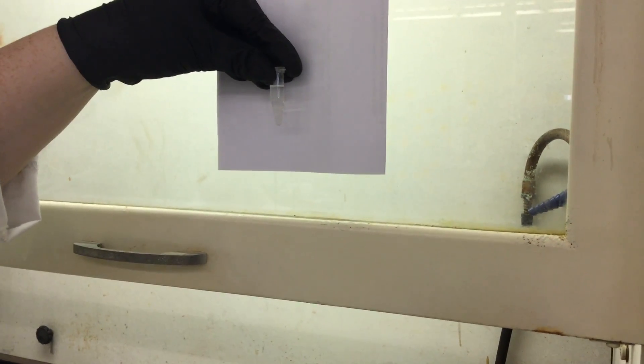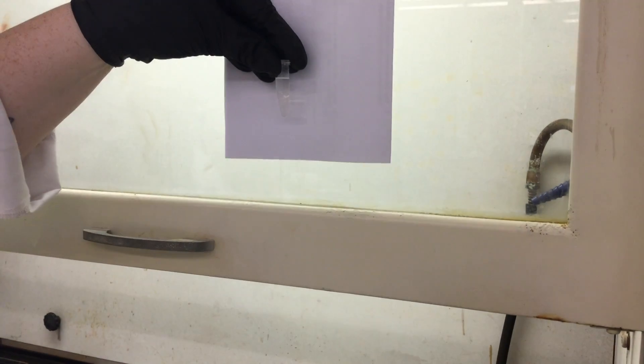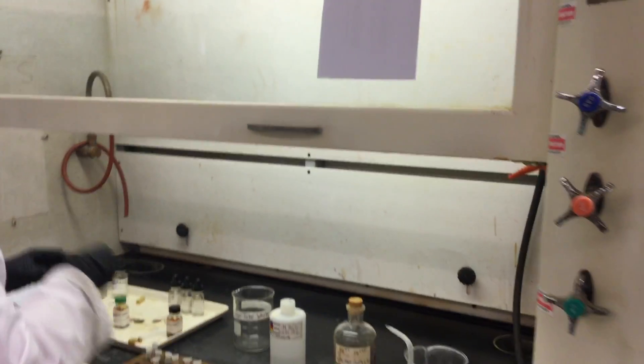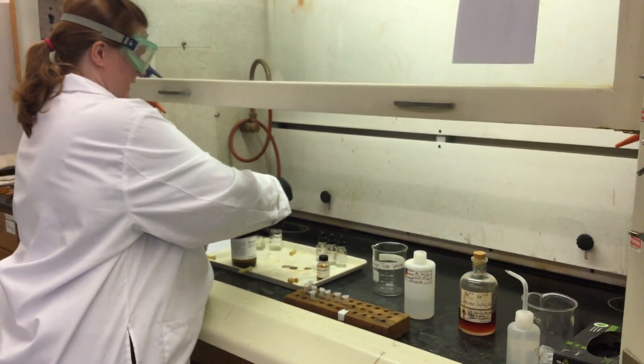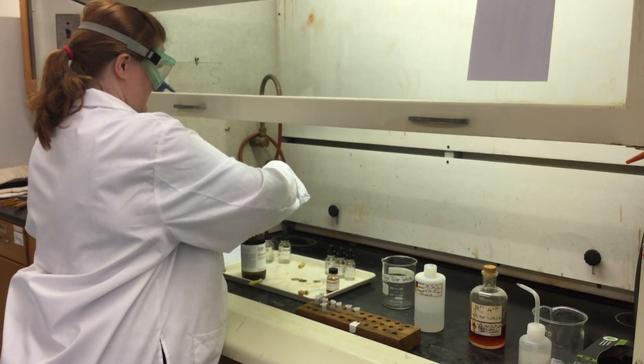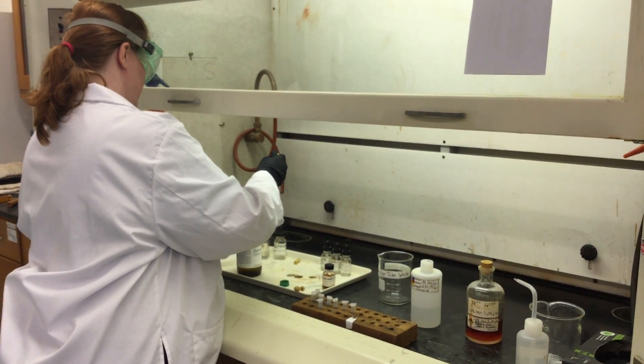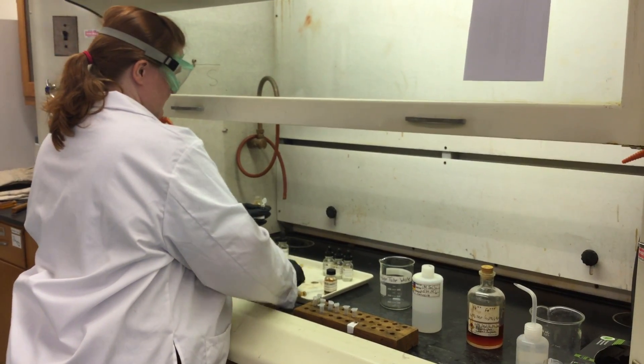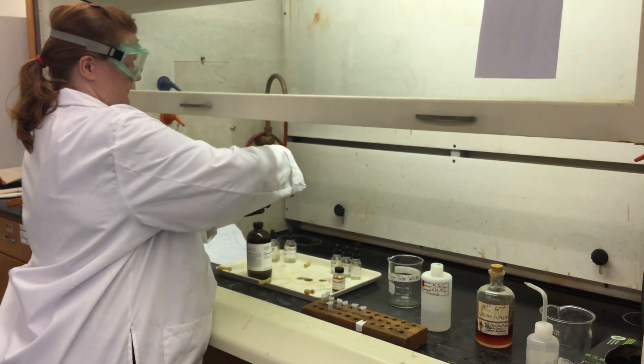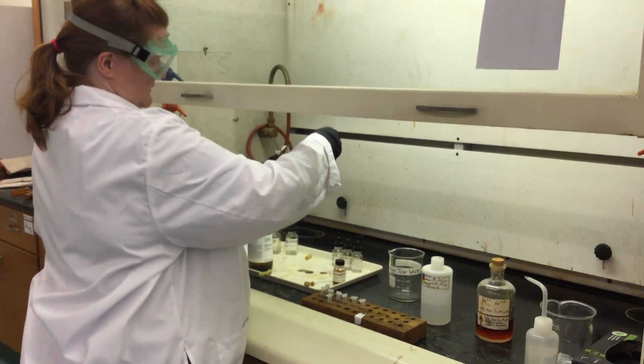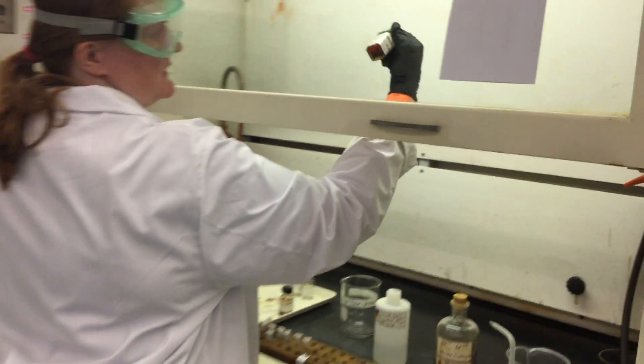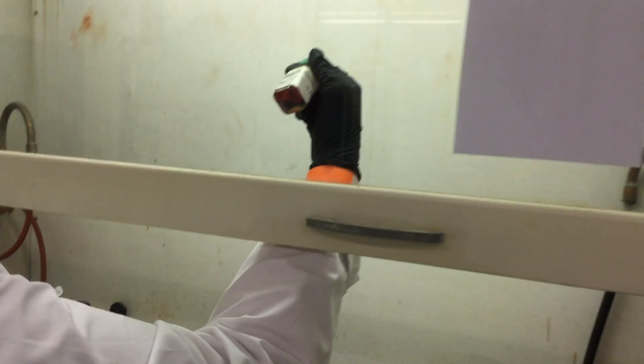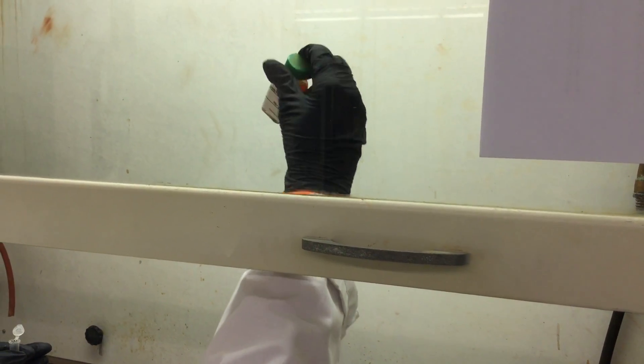The next one I'm going to do is bromine now. What's interesting when you dissolve it in water, these solutions are saturated, so we actually can see some of the liquid bromine in the bottom—that's the darker orange color—and then you can see the aqueous layer is pretty relatively pale orange.